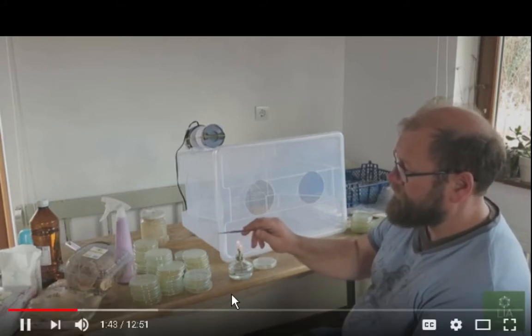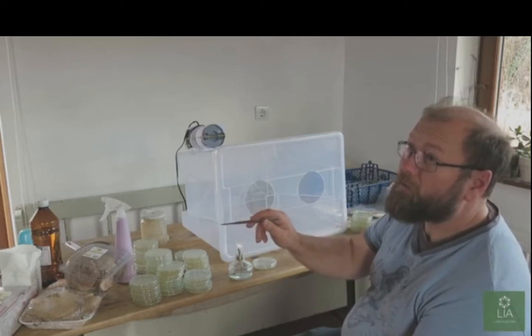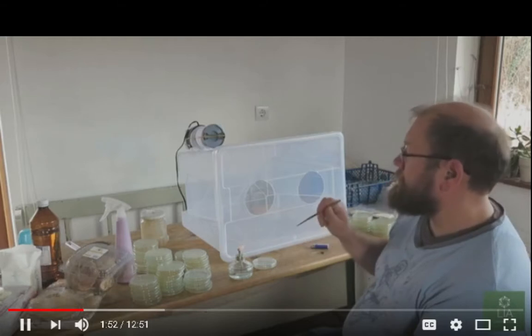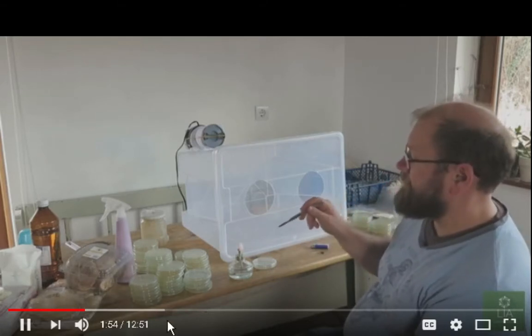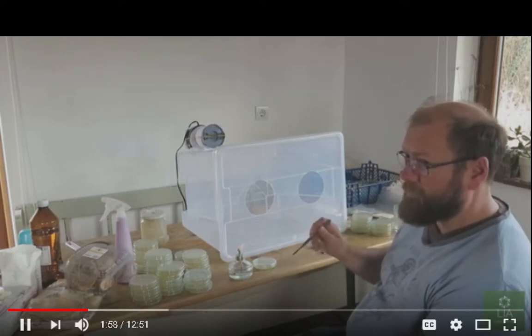We've got shiitake. Oh, this is 12 minutes long. Oyster and chestnut. And white button. And white button mushroom. Okay, so we'll take these tissue samples and put them into Petri dishes, and we can go on from there. Okay.